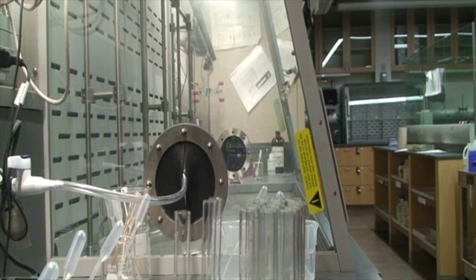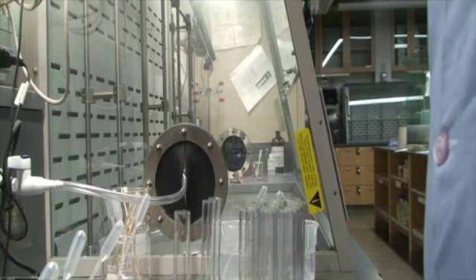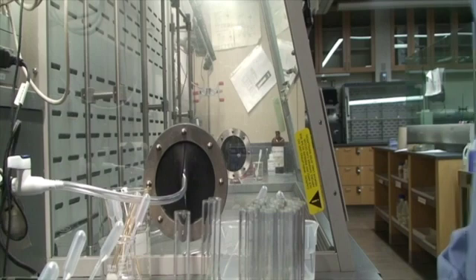Okay, so now what you're going to do is take that data, and we'll have a summary chart for you as part of this video. You're going to figure out by those reactions the identity of each of these unknowns, 8 through 13, and you're going to have to write down your reasoning.